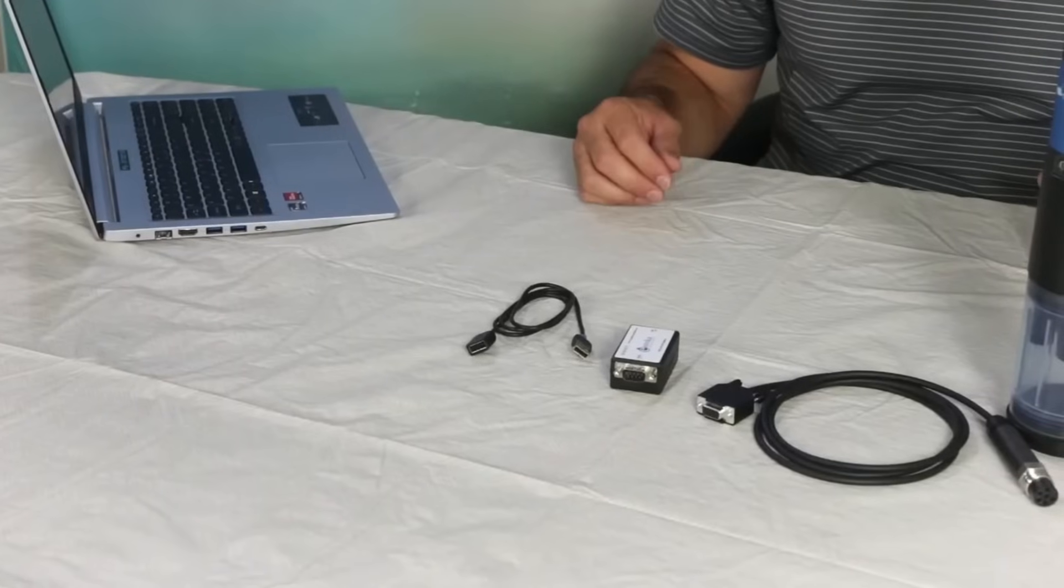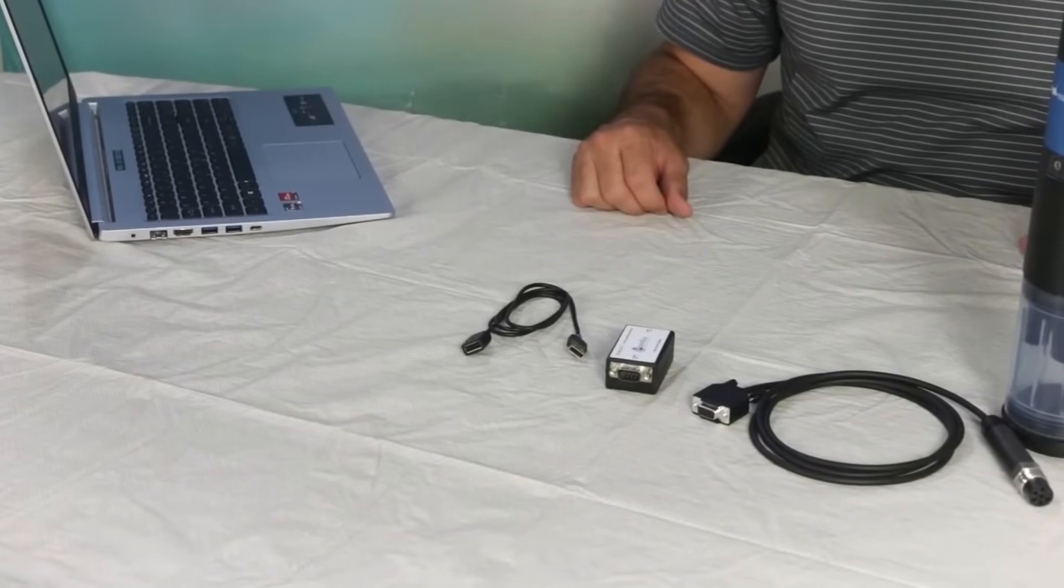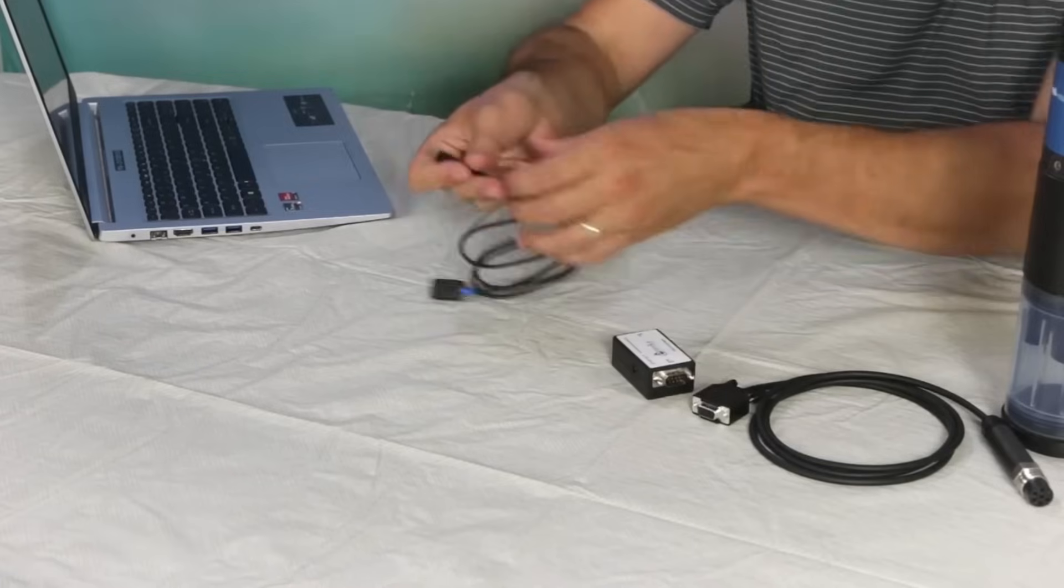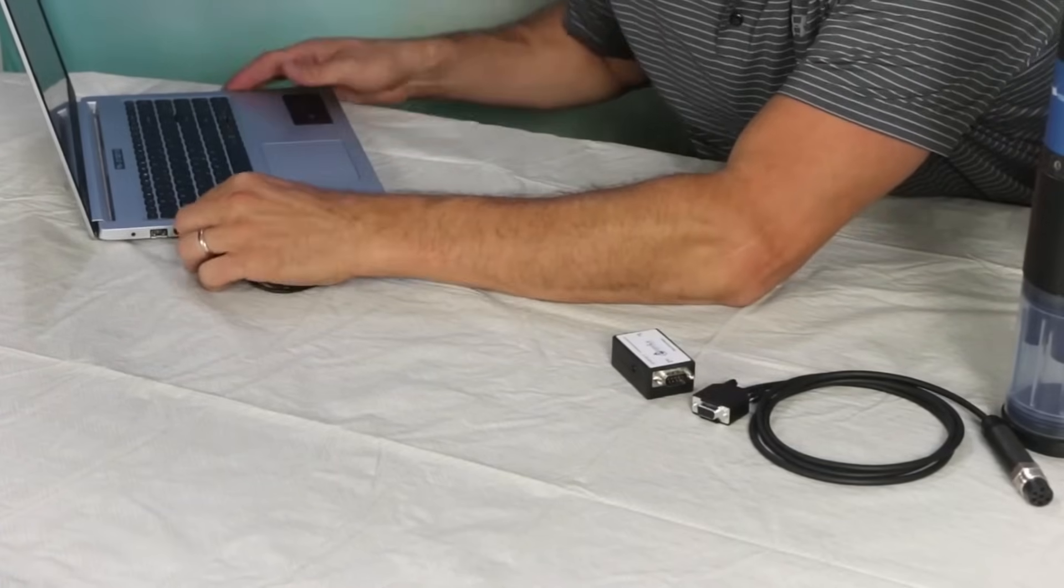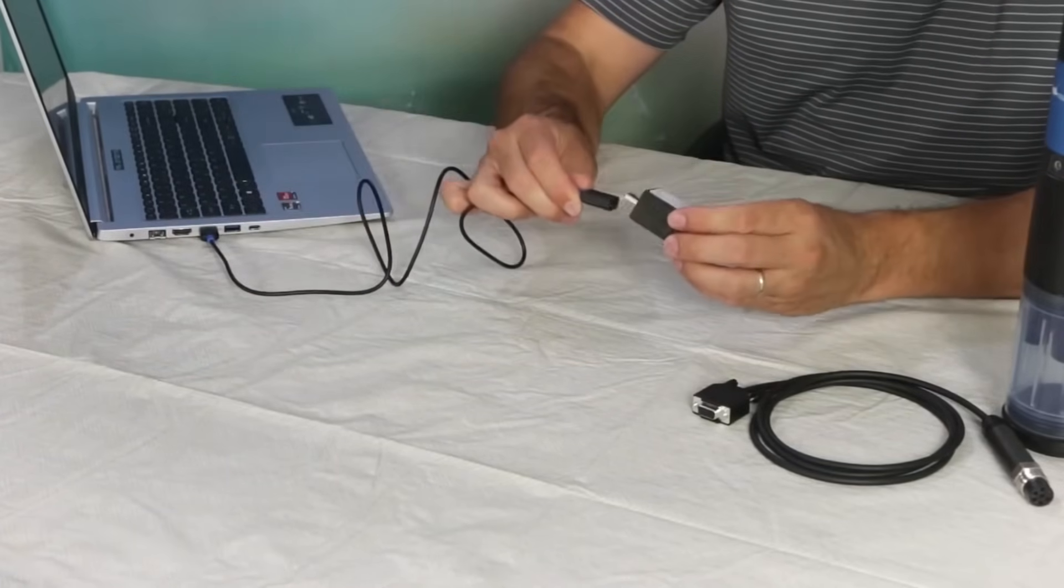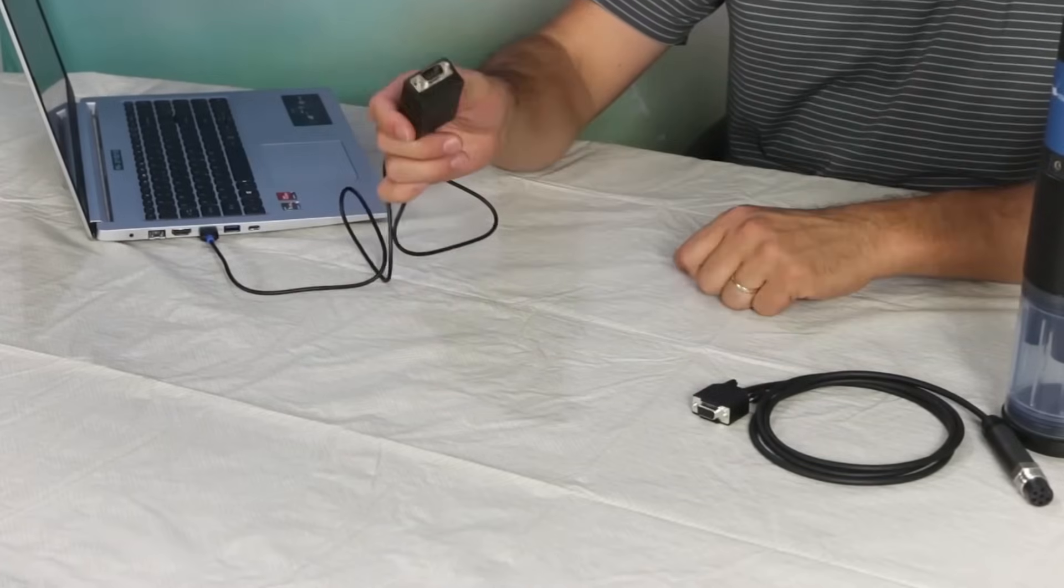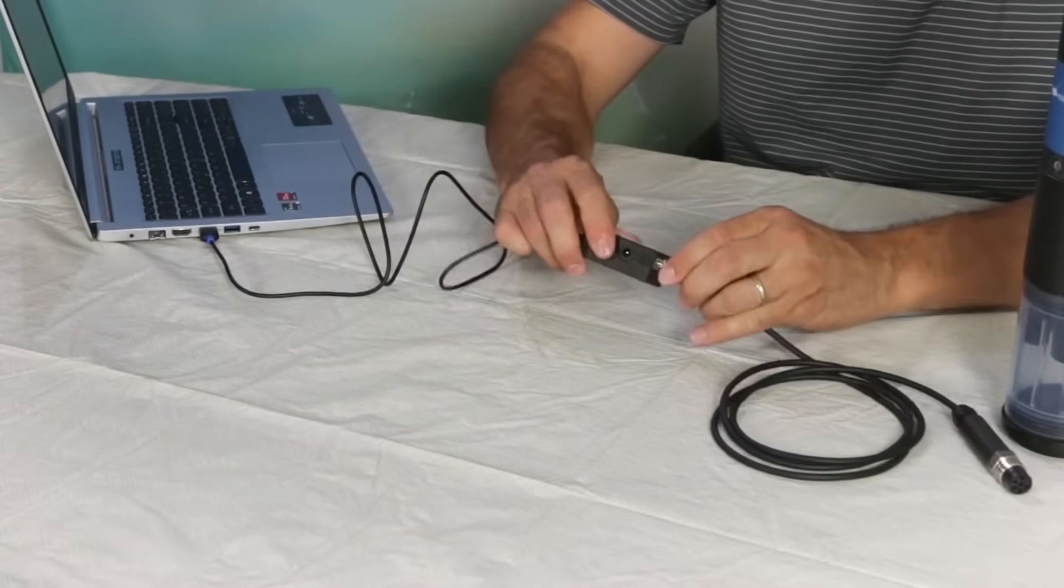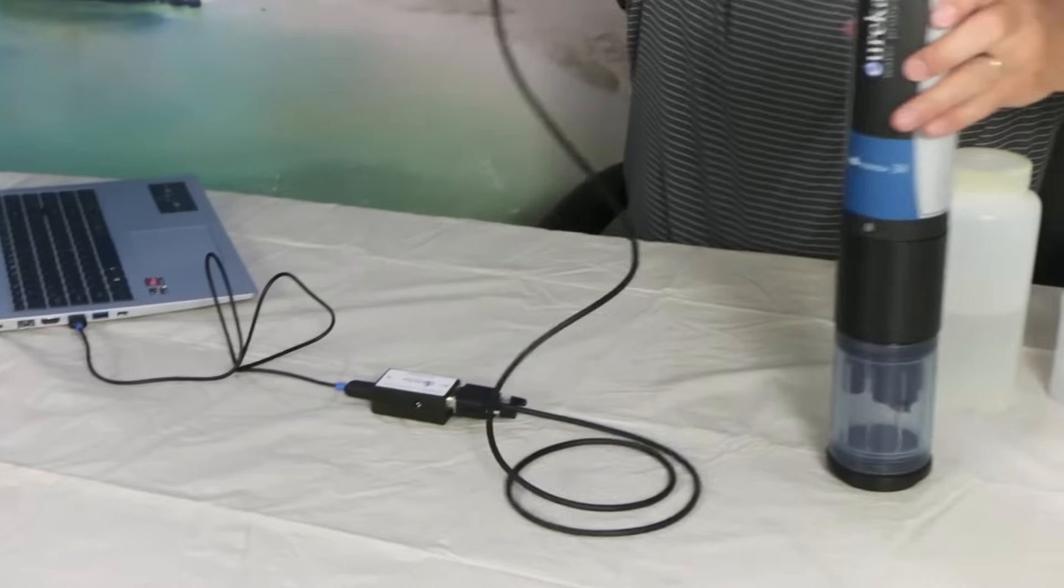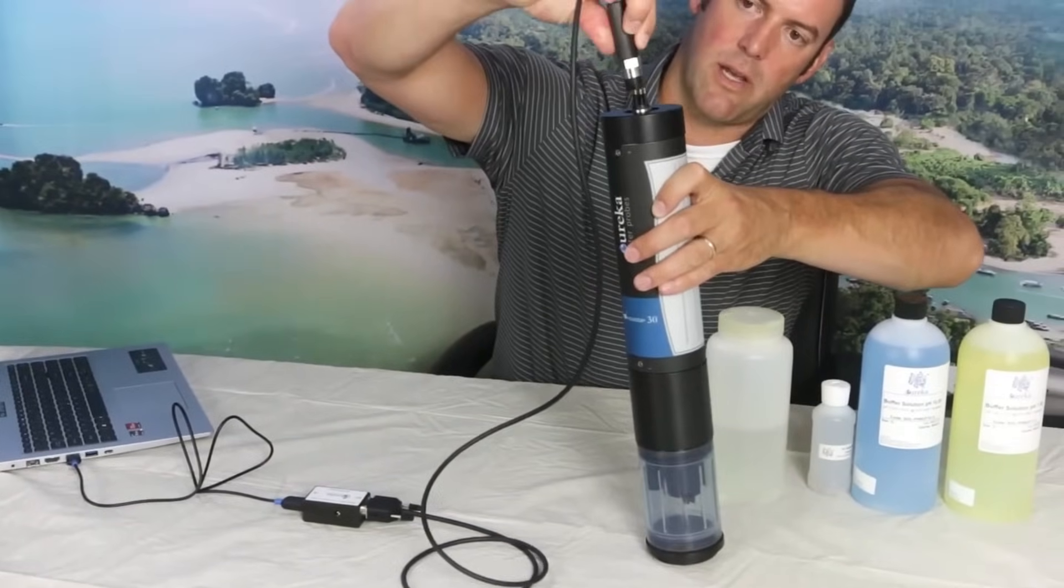Okay, now that we have your instrument cleaned and ready to go, we're going to connect it to the computer. So we'll take our USB cable connected to the computer. Other end goes to our USB to serial adapter. Nine pin end connects to the data cable, and then our six pin end connects to the sonde.